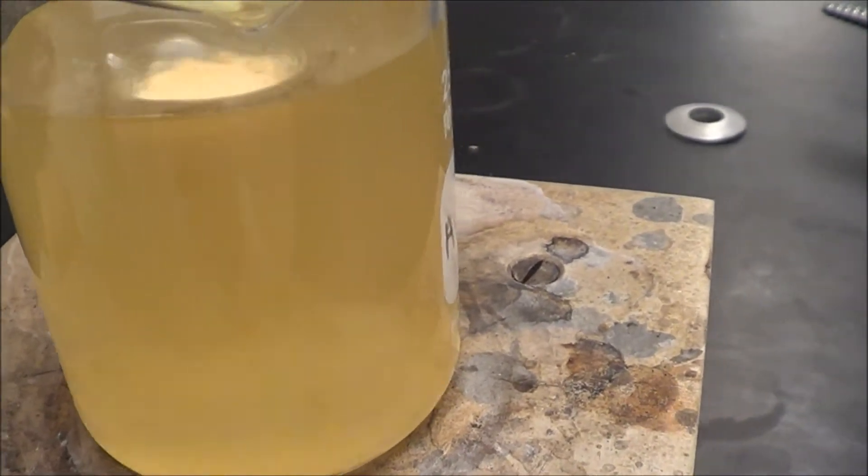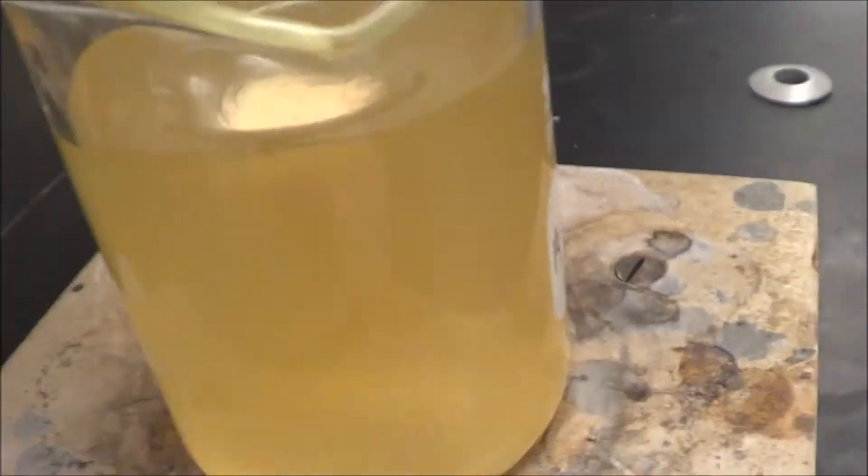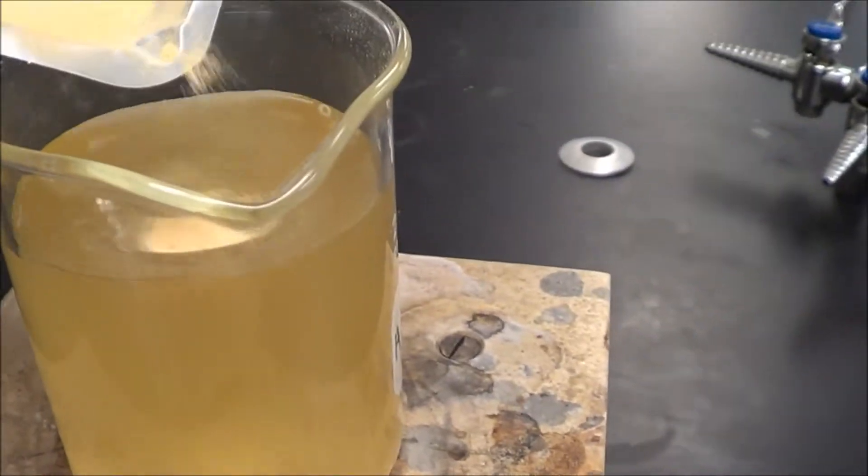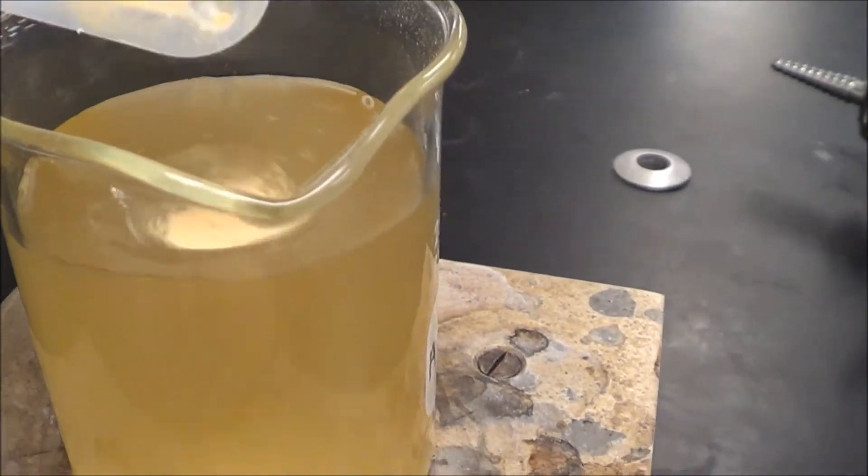And so then, right here we have 200 milliliters of distilled water in here. And this is about 5 grams of agar, by the way, if you're wondering the correct ratio.